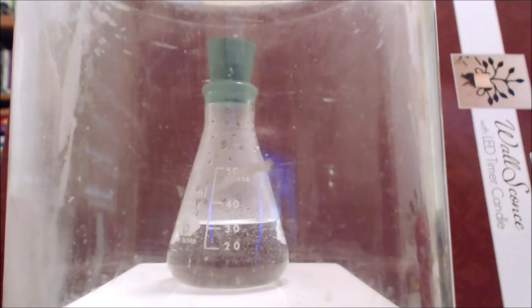Of course, the vapor pressure of water increases with temperature. So inside, in the gas phase, there's water vapor and air. And the heat is causing the air to expand, and it's causing the pressure of the air to build up because the temperature rises. It's also causing the water vapor pressure to increase.